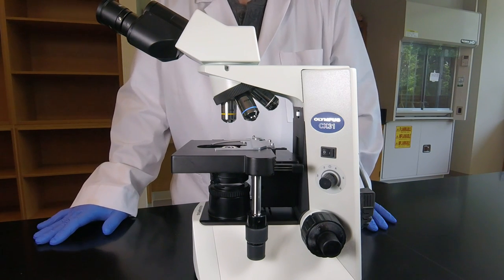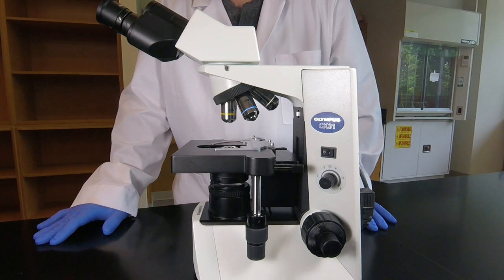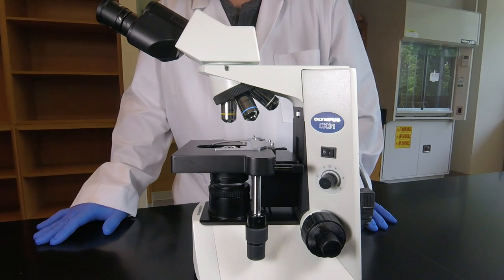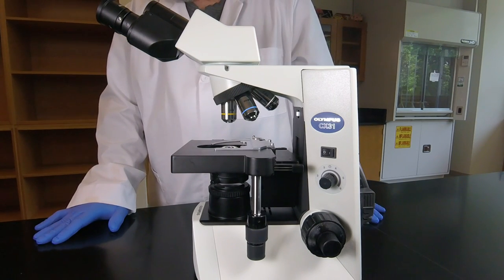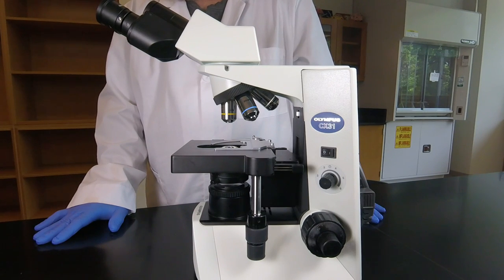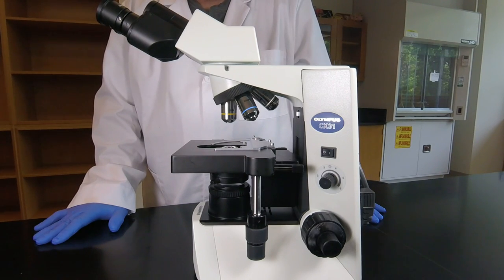Hello! In this preliminary to focusing video lesson, we're going to learn a number of things to get us ready for the focusing video coming up. We're going to learn how to move and transport the microscope, how to adjust the eyepieces, how to position the slide on the stage, how to adjust the illumination, and how to obtain different magnifications.